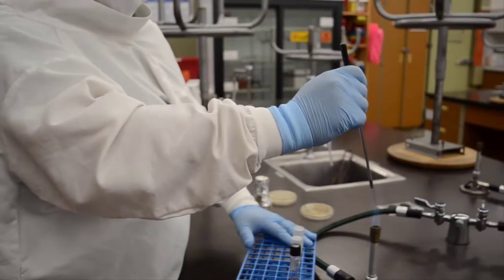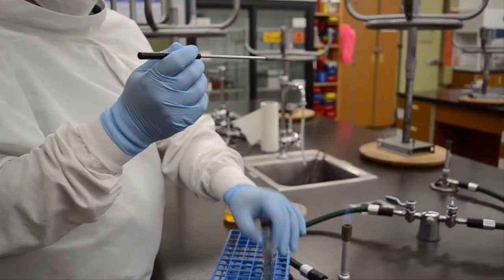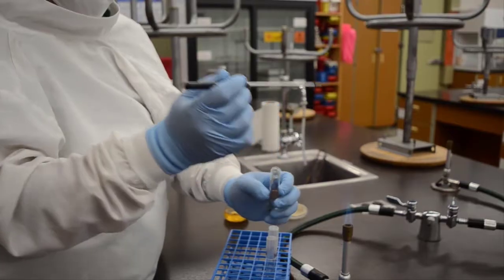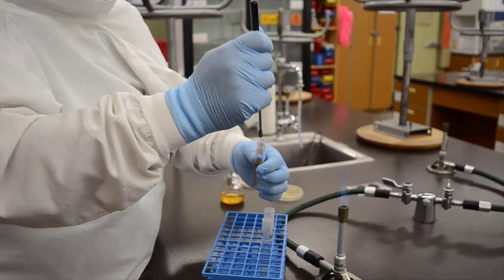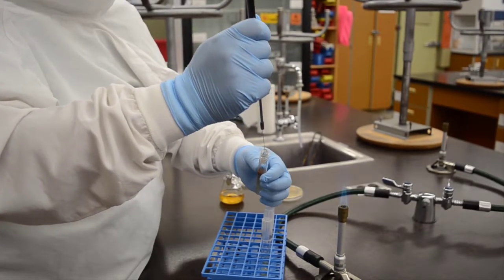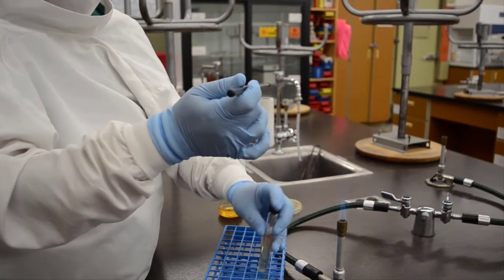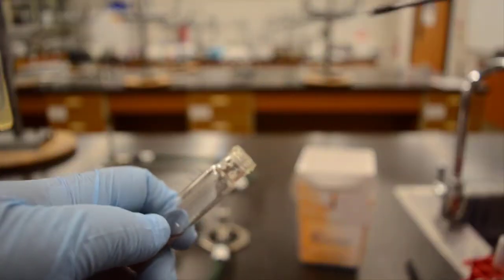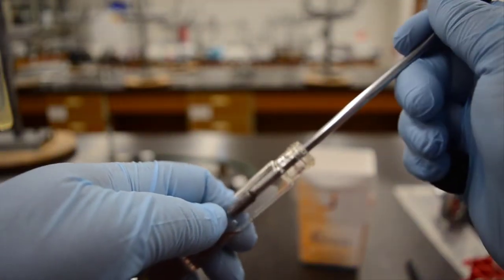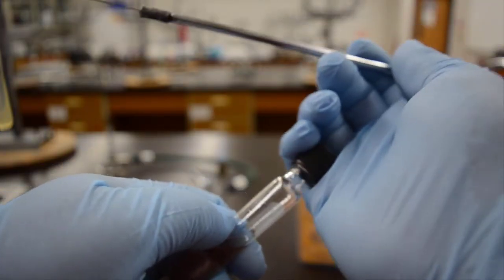Here we're going to demonstrate the same procedure, only using a more traditional tube called a screw top tube. This one is a little bit trickier in that the top is smaller and you have to hold it with your pinky. When you're doing this procedure, you want to try as much as possible to not put caps of tubes or lids of plates directly on your work surface. That could contaminate your tube. So we try to hold it in our instrument hand and then move the tube in and out of the cap. Here you'll see a detail of how that's done. Notice that the pinky holds the cap and you screw the tube out of the cap, perform your inoculation, and then put the cap back on by screwing the tube into the cap.